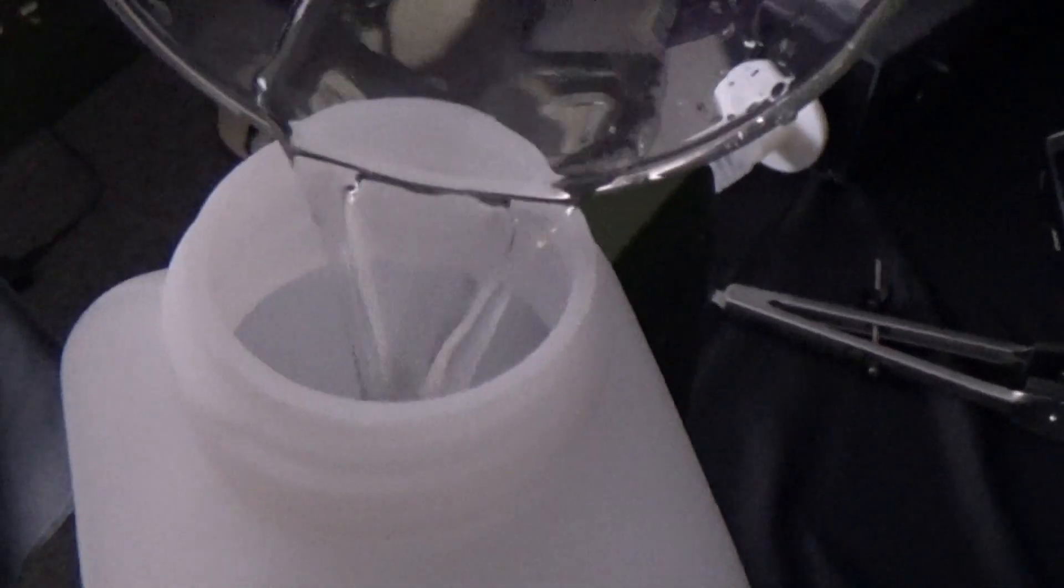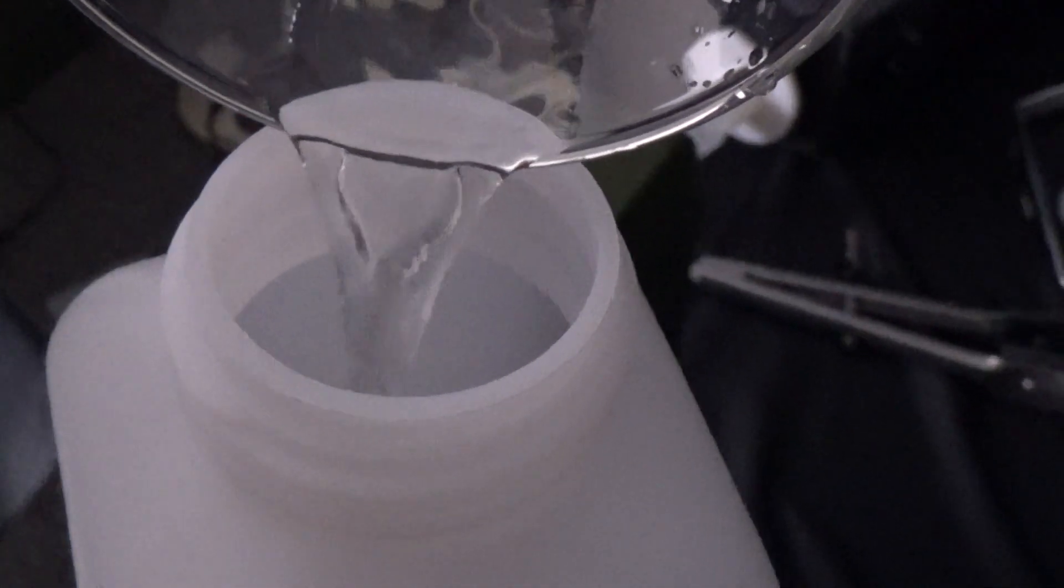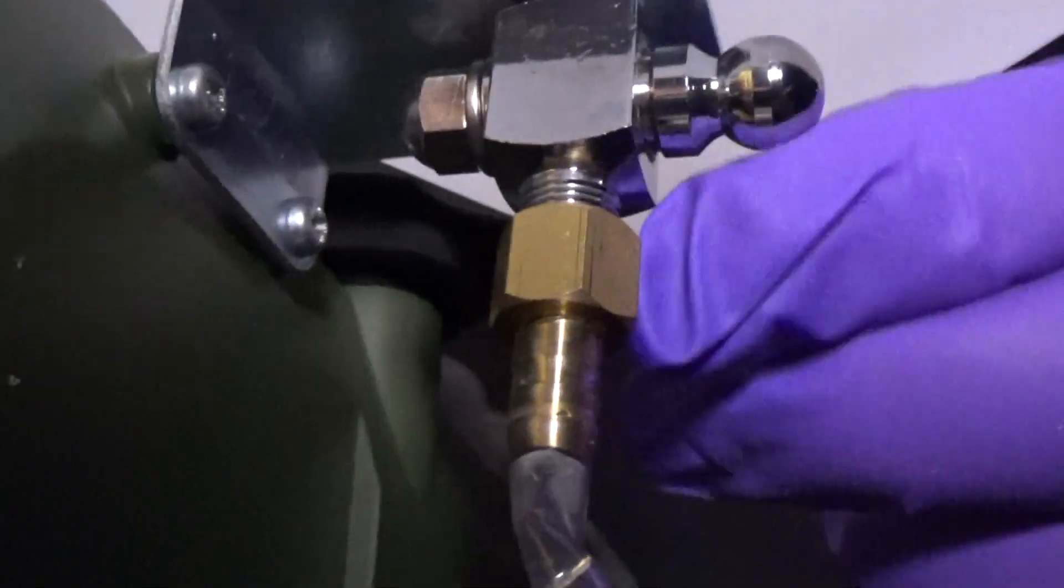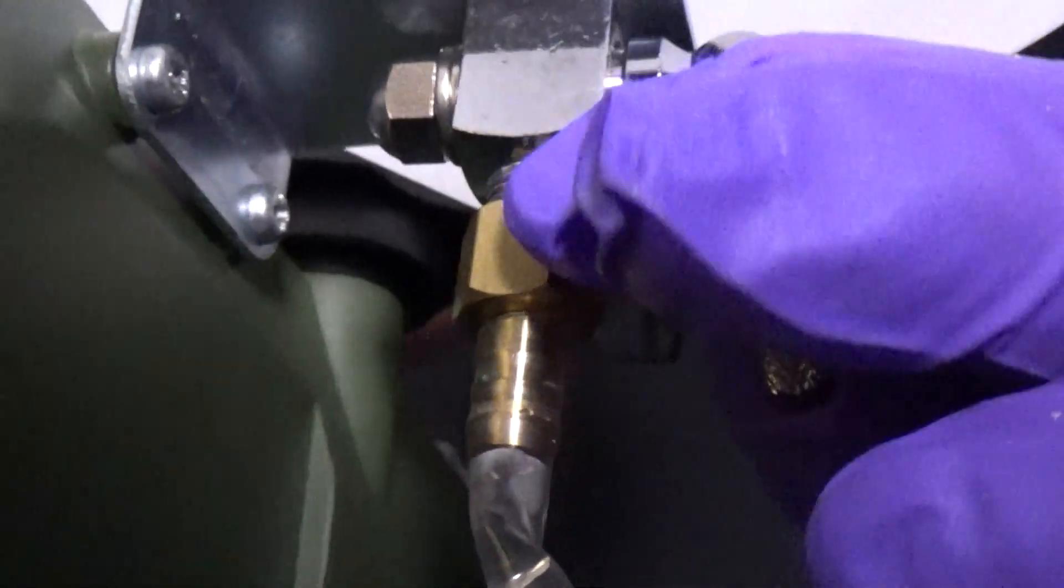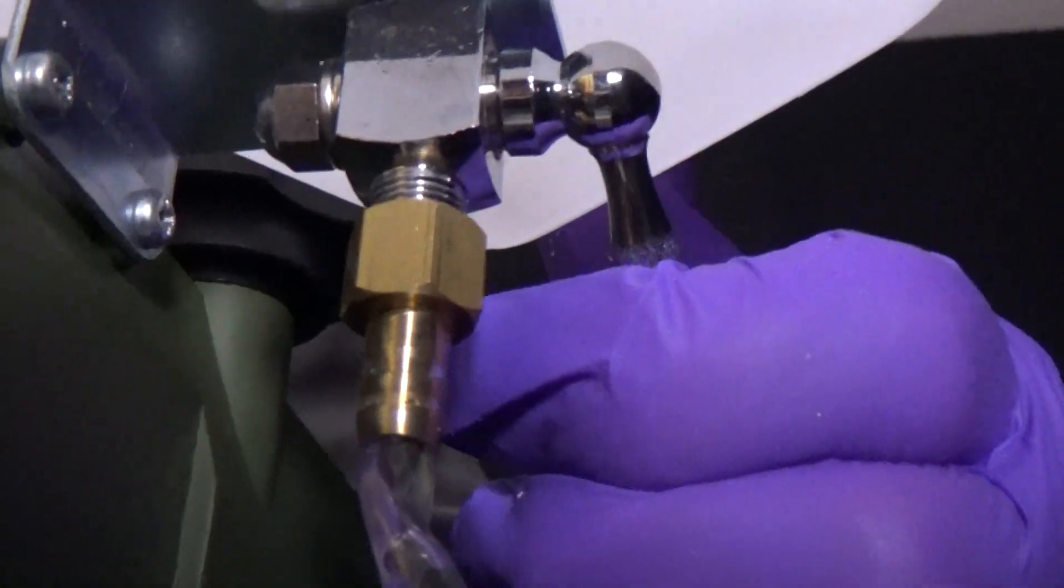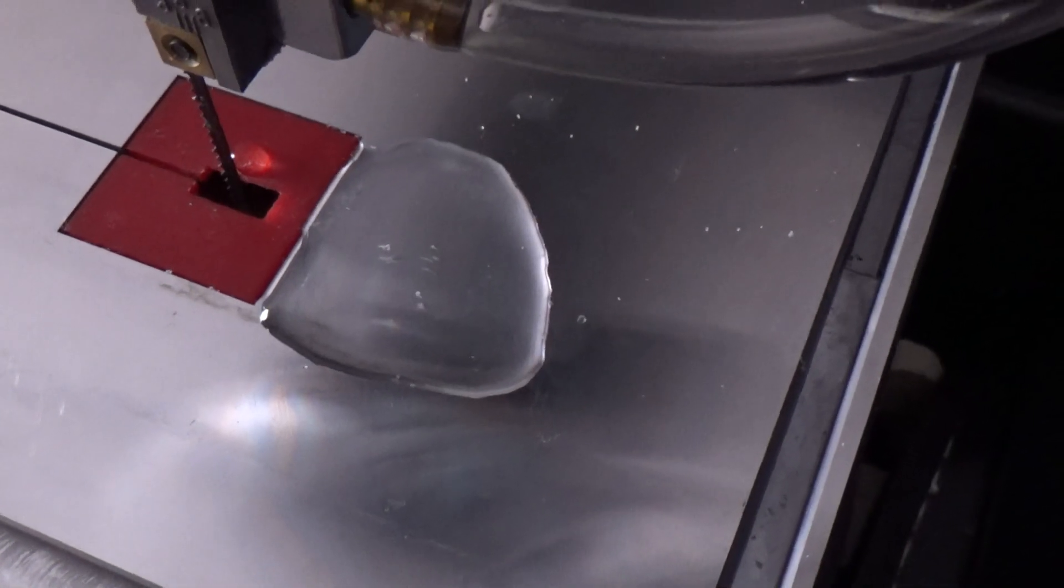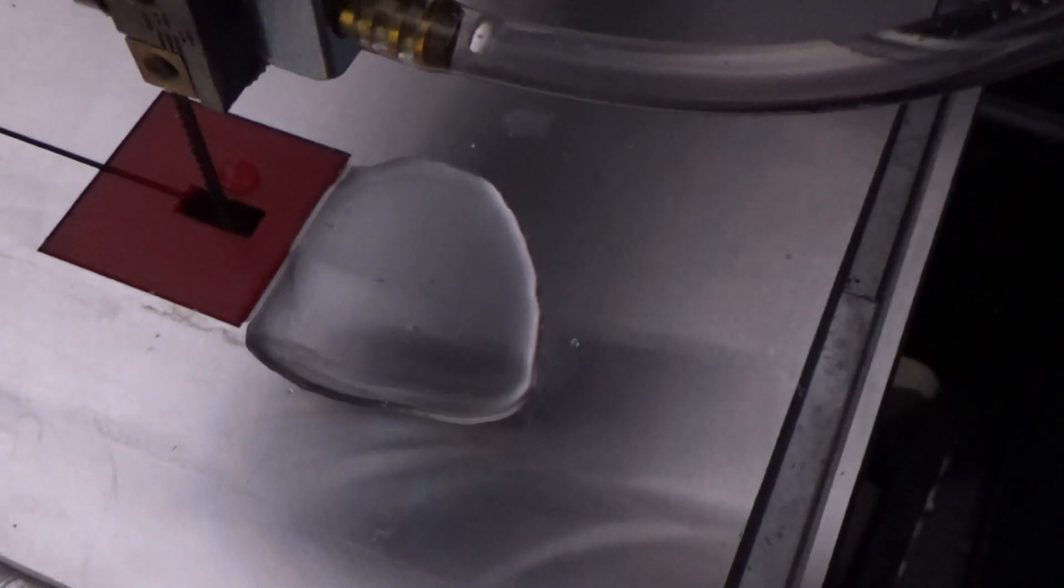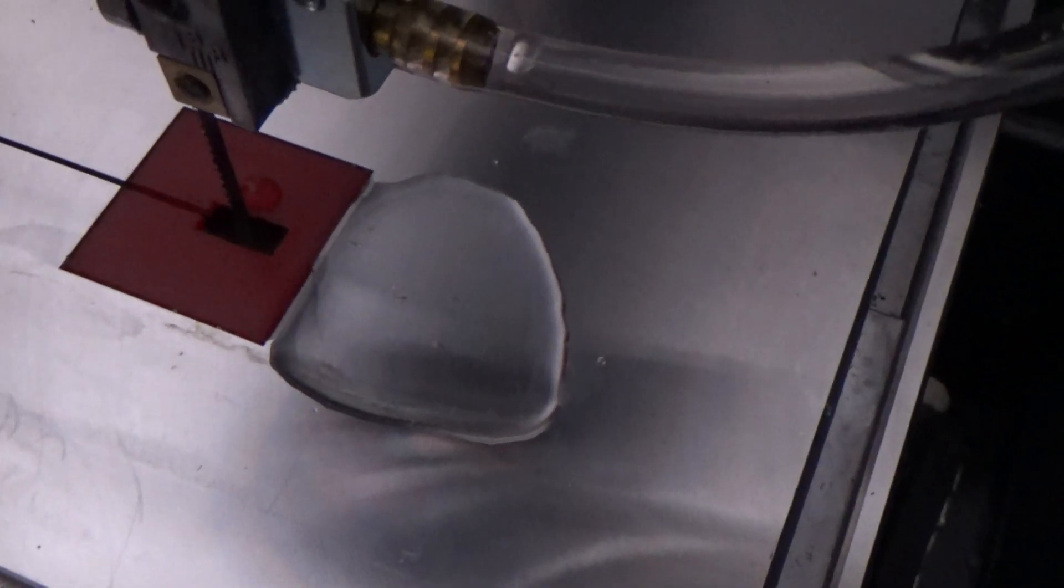When using the water cooling system, fill the bottle up. Then to get the water to begin flowing, push the valve down. To stop the water from flowing, push the valve back to 90 degrees.